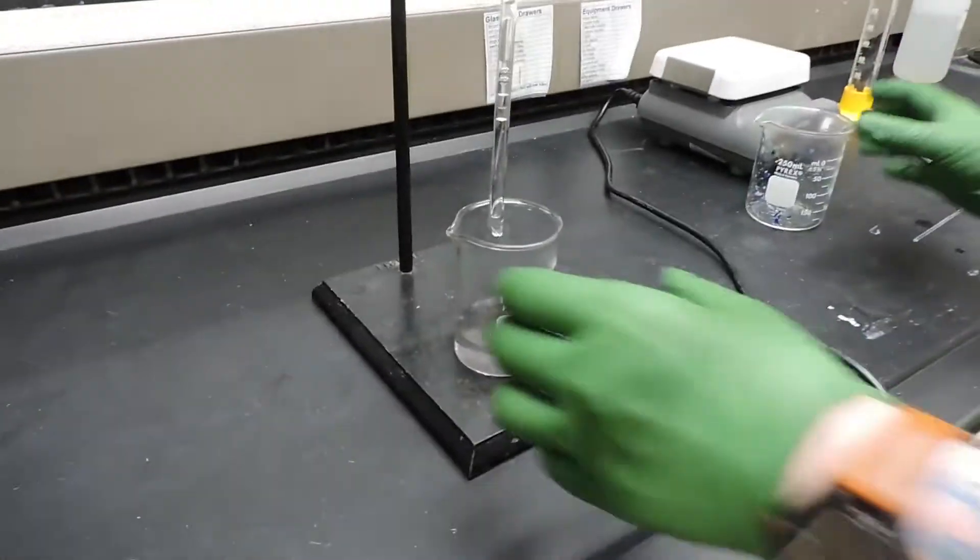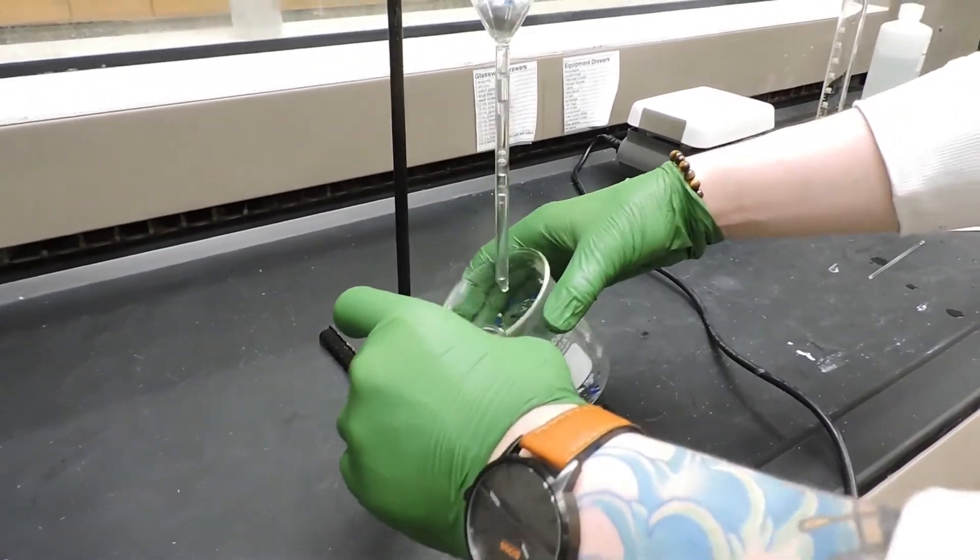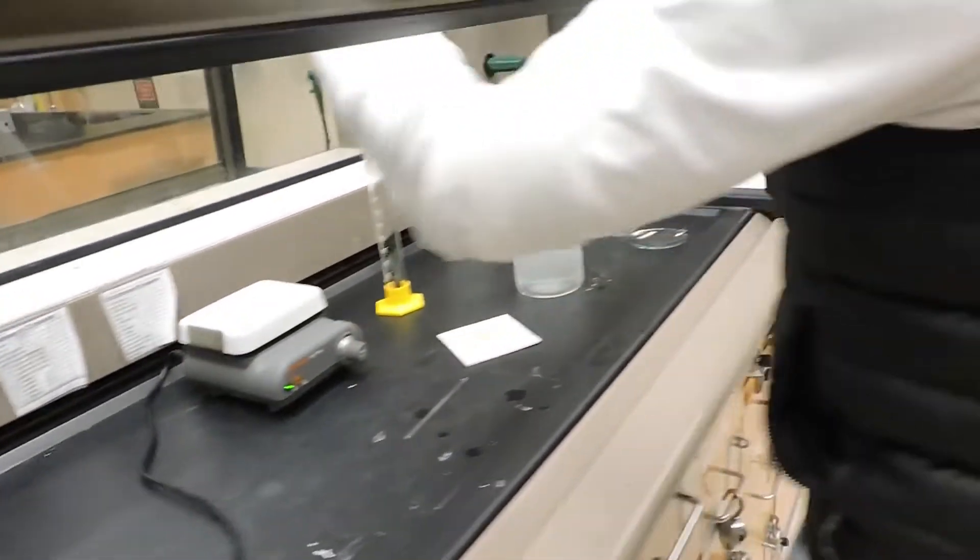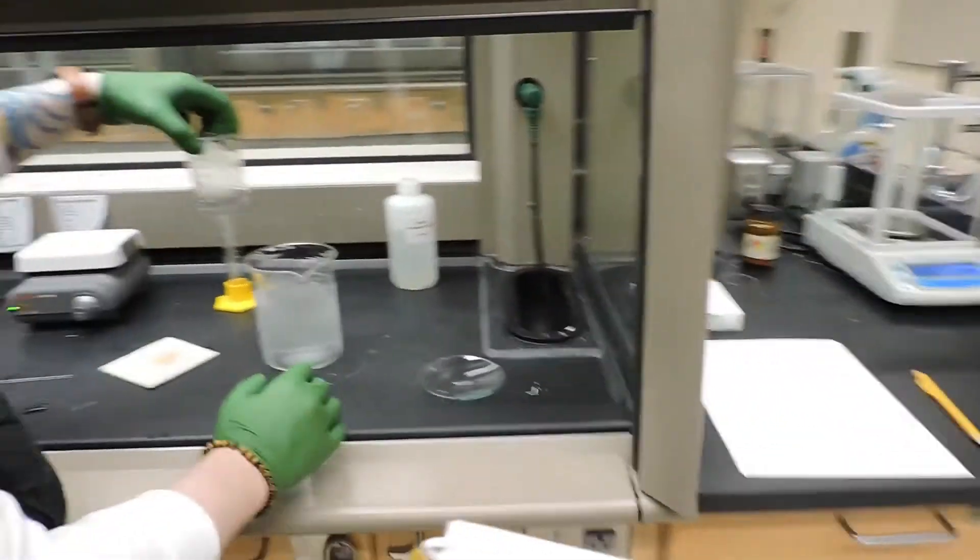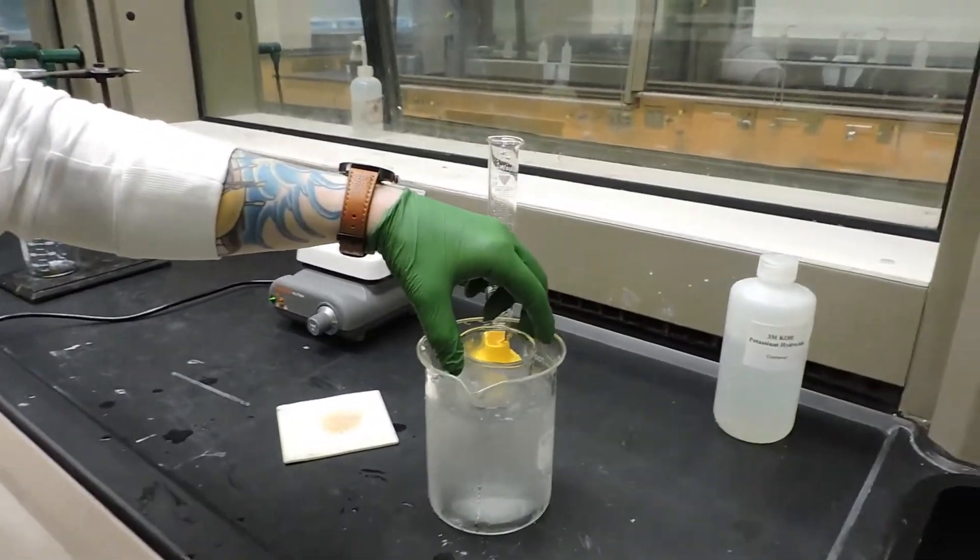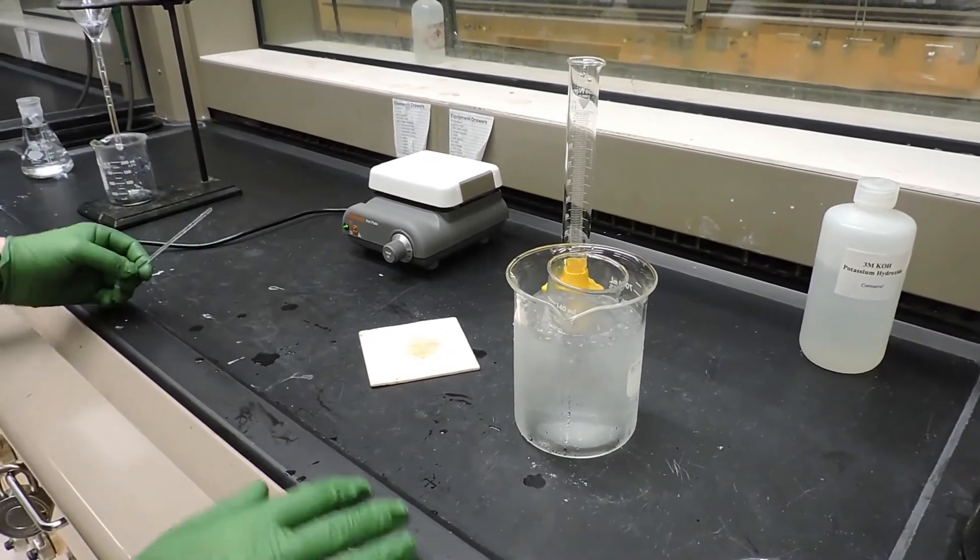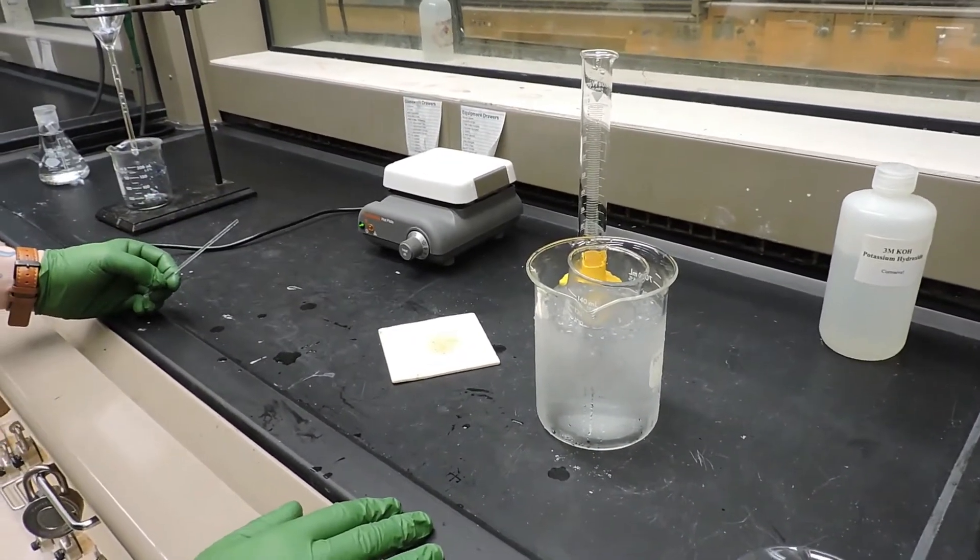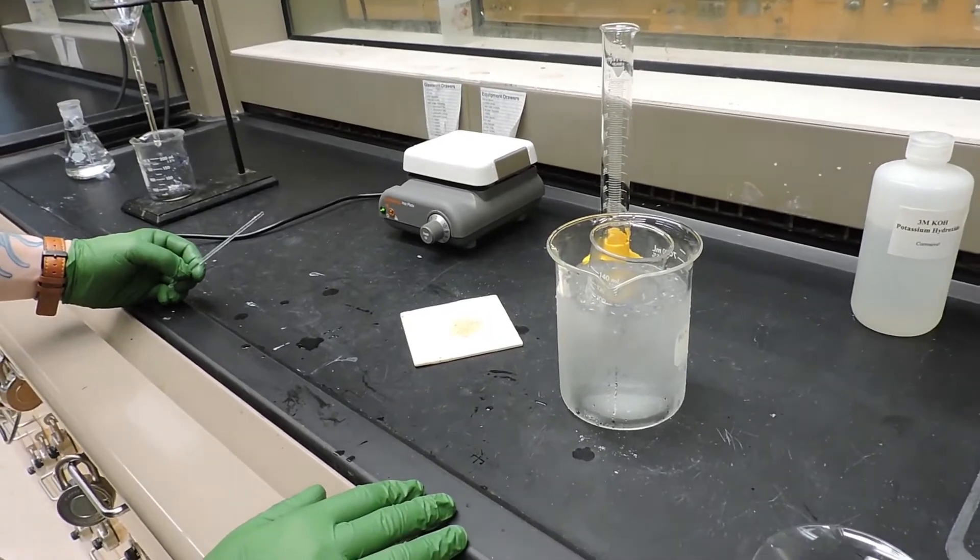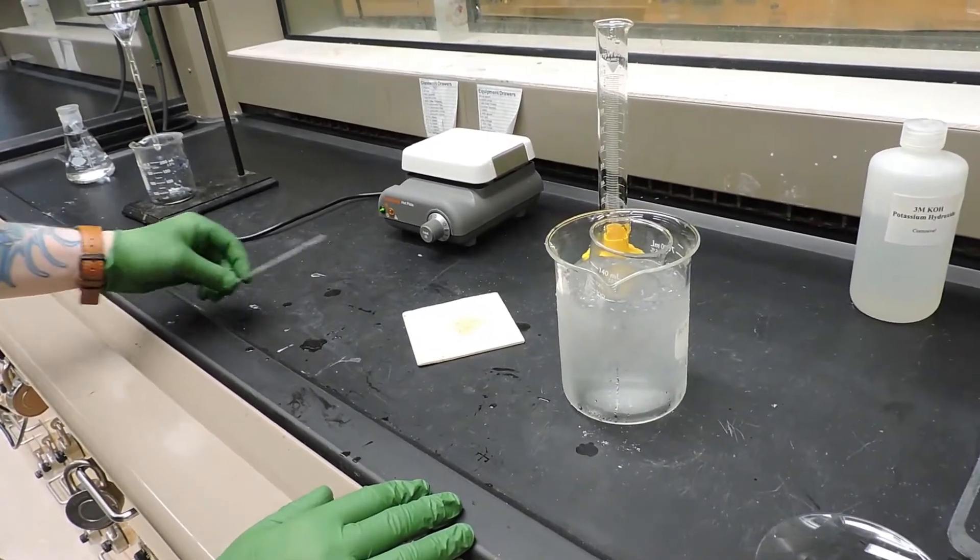We'll then cool this mixture in an ice bath. And occasionally we will stir the solution, and we will keep this in the ice bath until the temperature has dropped below 5 degrees Celsius.